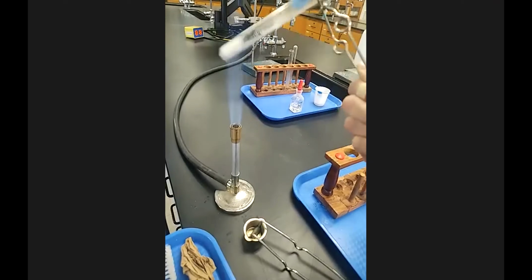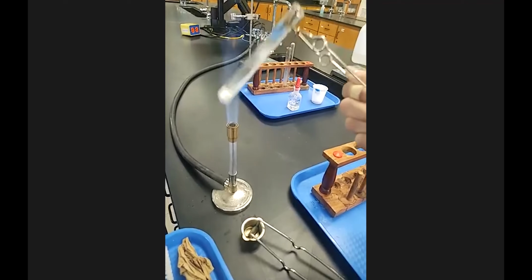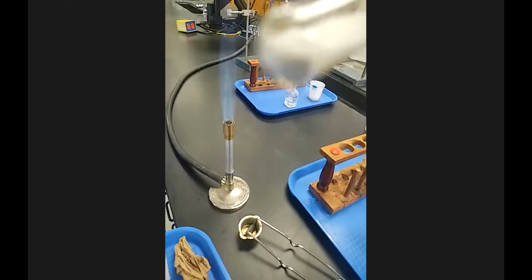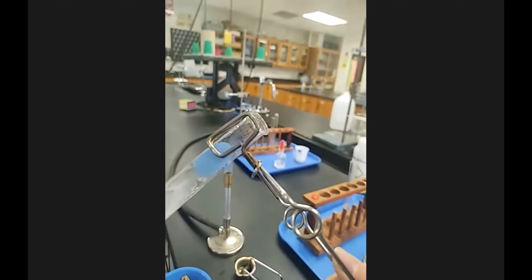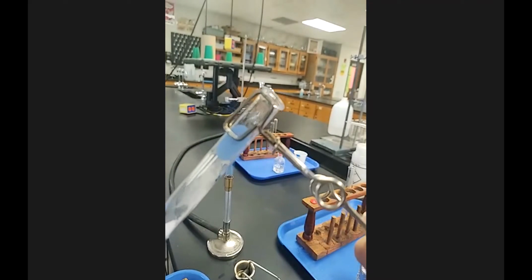So I'll heat it just a little bit more. Still alive. I'm going to take it out. Forms those little grooves. And you've got that. It's a little bit stickier to itself. And then the top of the test tube there, it's got all those.